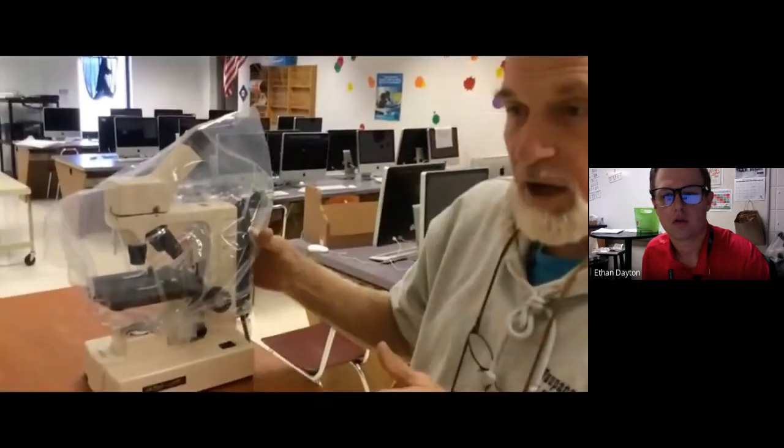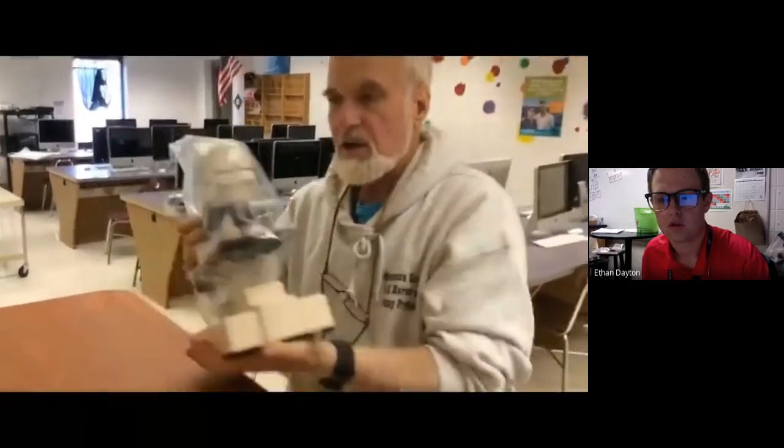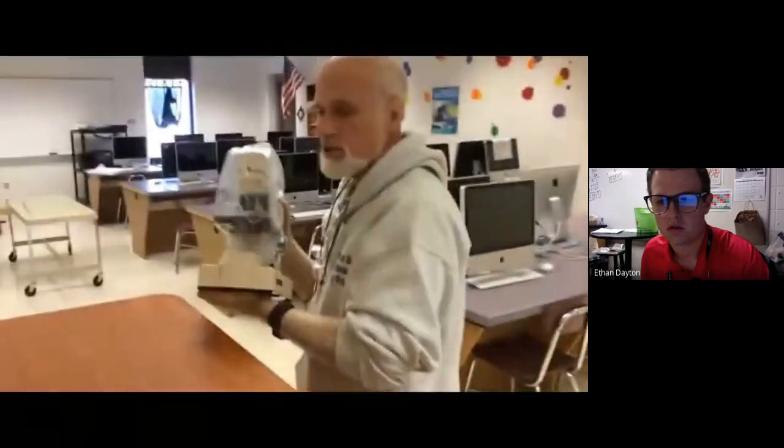And then again, we carry it back to the cabinet by grabbing the arm, supporting the base close to the body with our elbows in, and carrying it back to our position. And putting it under the number, we have number 6 here, so that would be our number 9. That would go in slot number 9 on the cabinet.